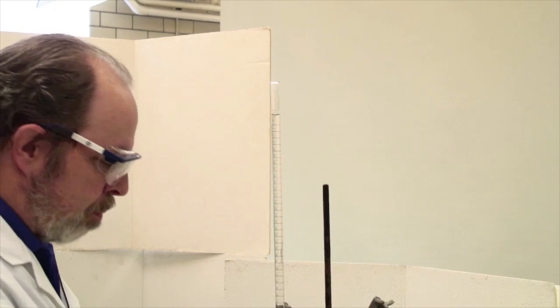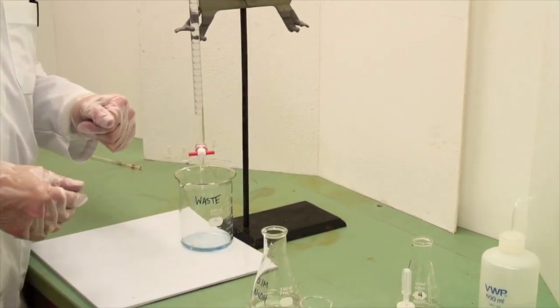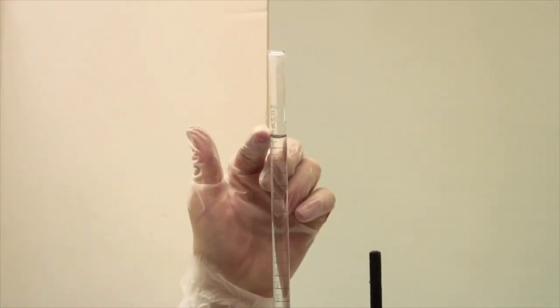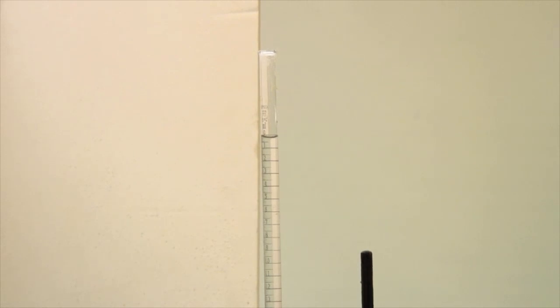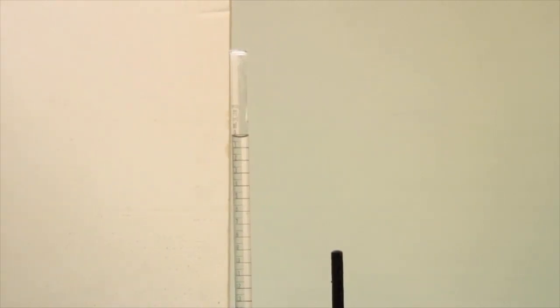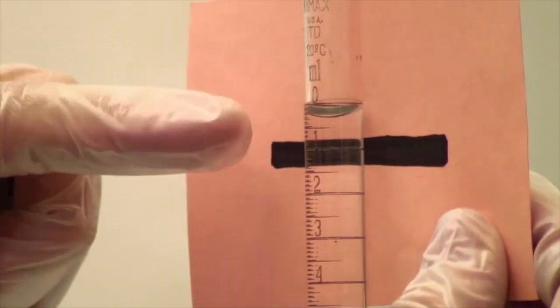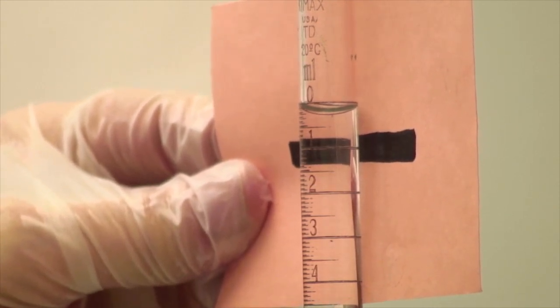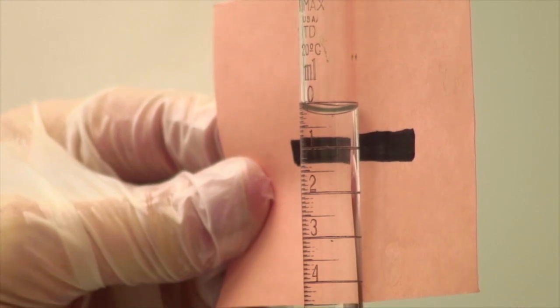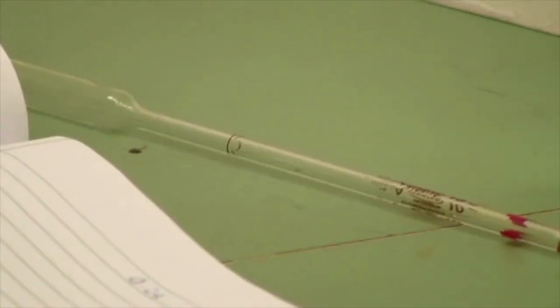Now once you've filled it, and I've filled this above the calibration mark, put your waste beaker underneath, open the tap, and just get it somewhere inside. Make sure that you get it to inside the calibration line rather than aiming exactly for 0.0. That involves a fair amount of wishful thinking, and there's also no calibrations above to help you with that. Using a burette reader, make sure that you read the initial volume. Place the dark line about 5 millimeters below, and it will color the meniscus. This one is about 0.20, 0.24. Record this in your notebook. Notice, ink in a bound notebook. Nowhere else is acceptable.